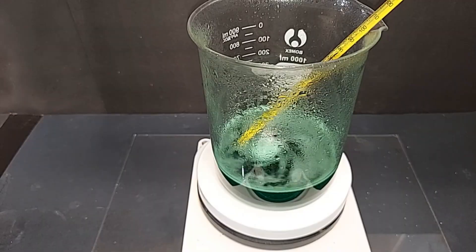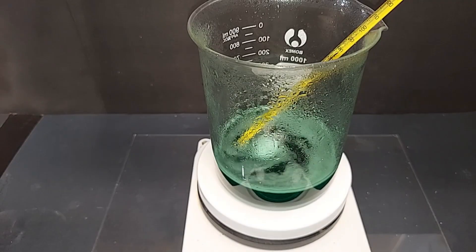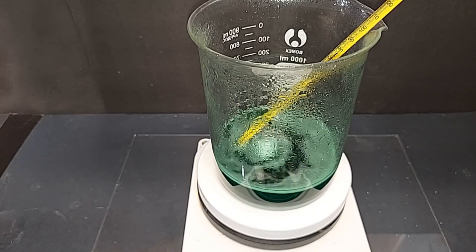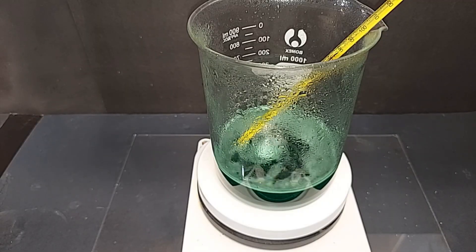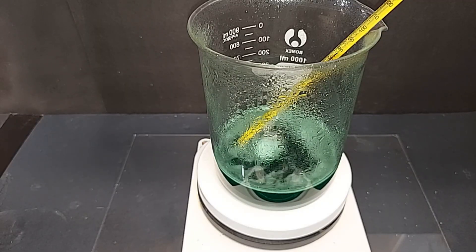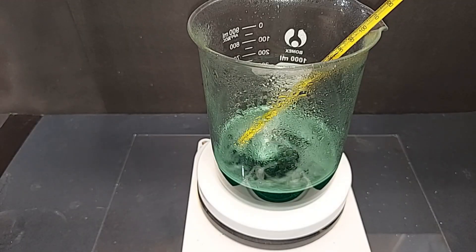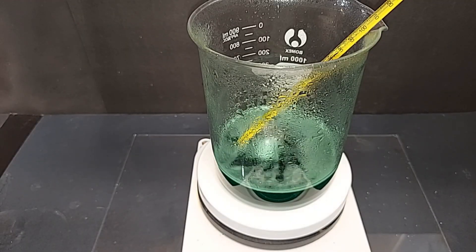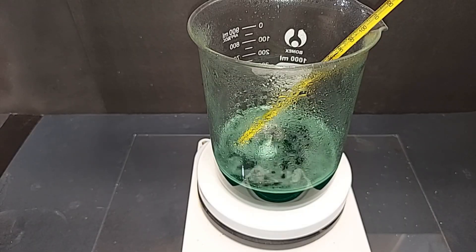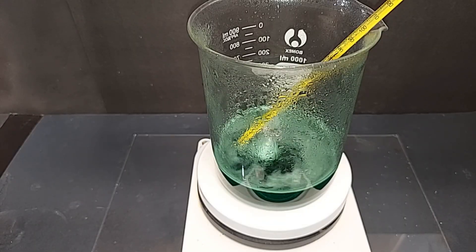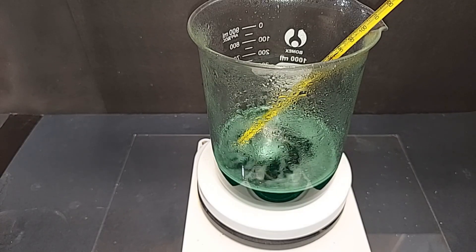All of the nickel is finally dissolved. I ended up adding another 30 milliliters of the 35% sulfuric acid and another 30 milliliters of the 30% hydrogen peroxide, and that finally did it. Everything's dissolved. We finally have a solution that is actually mostly water because the 35% and 30% of both of those leaves 65% and 70% water, so there's a lot of water in here plus the reaction itself produced water. We've got to get rid of that water and I'm going to start doing that now.